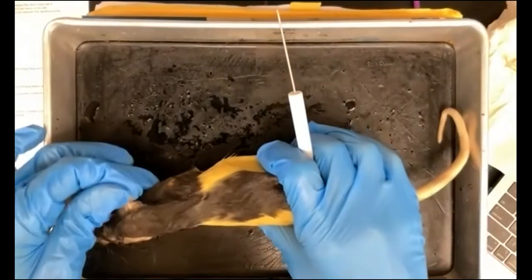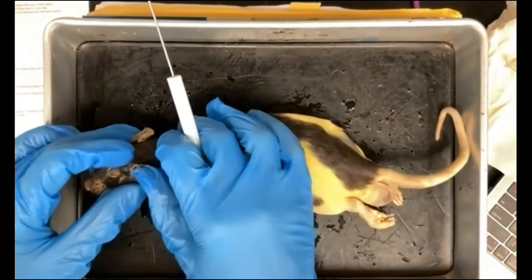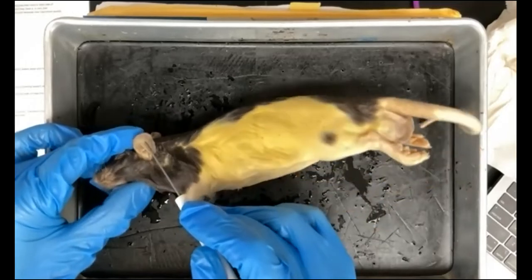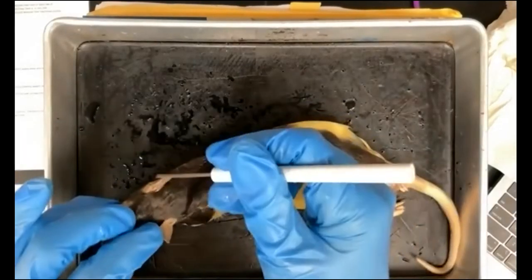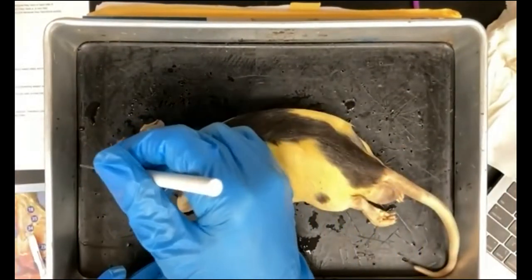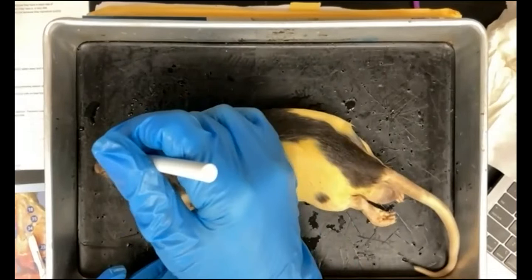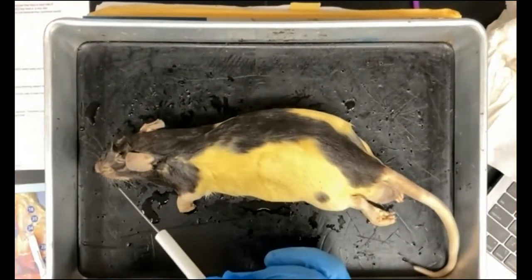Their ears are shaped like funnels, and this is to funnel the sound. So they have extremely good hearing, and you can see how wide their ears are. They act like funnels to funnel sound waves to their brain. They also have whiskers, and again, these are sensory organs. They can sense changes in air pressure, so they can sense when danger is nearby or another animal is approaching.